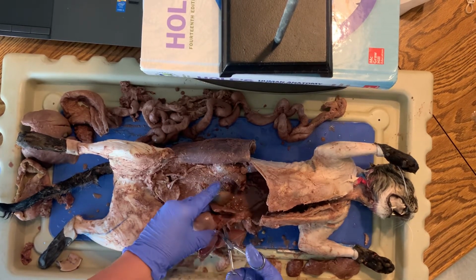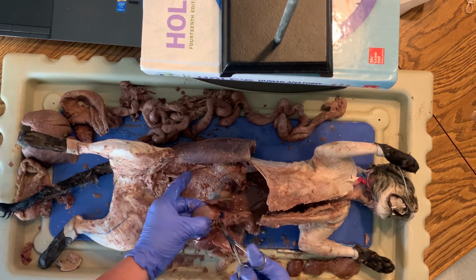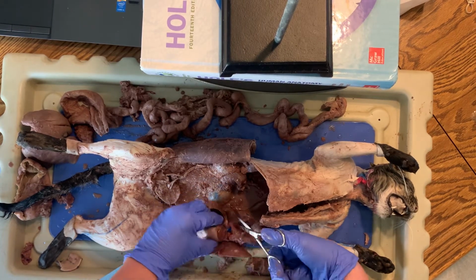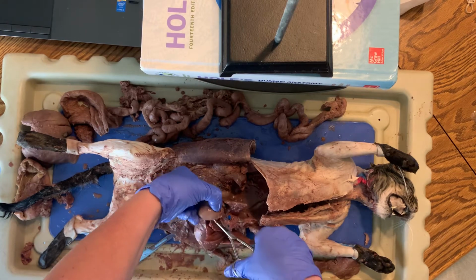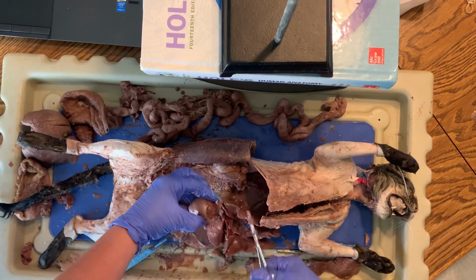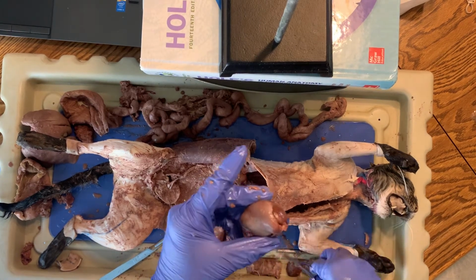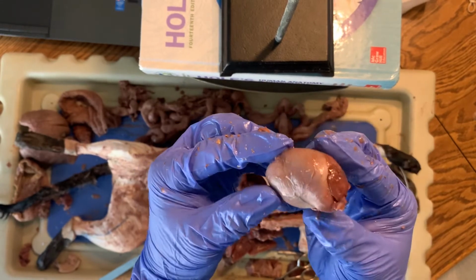And I will also repost the deer heart video for you to watch, because the cat heart parts obviously are going to be way smaller than the deer heart parts inside. But there is the cat heart. So if I hold it, I don't know what way is best for you.